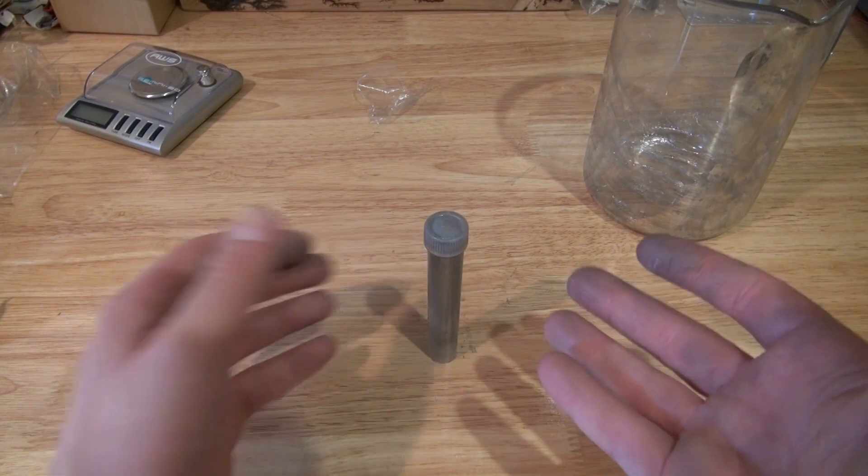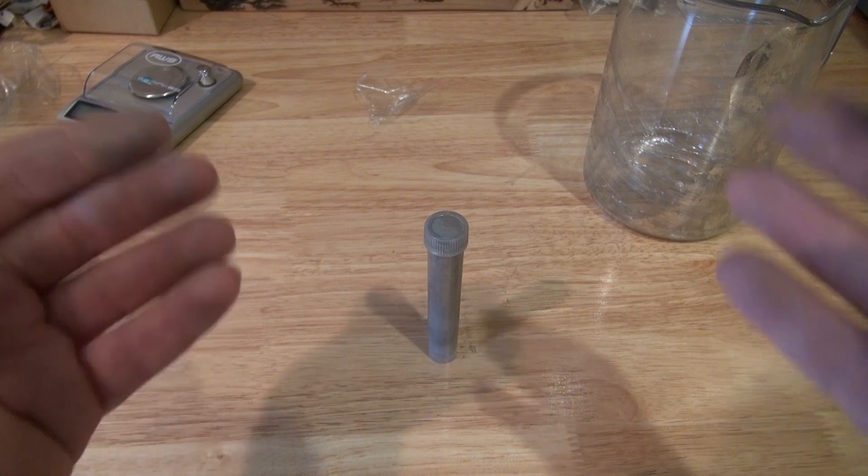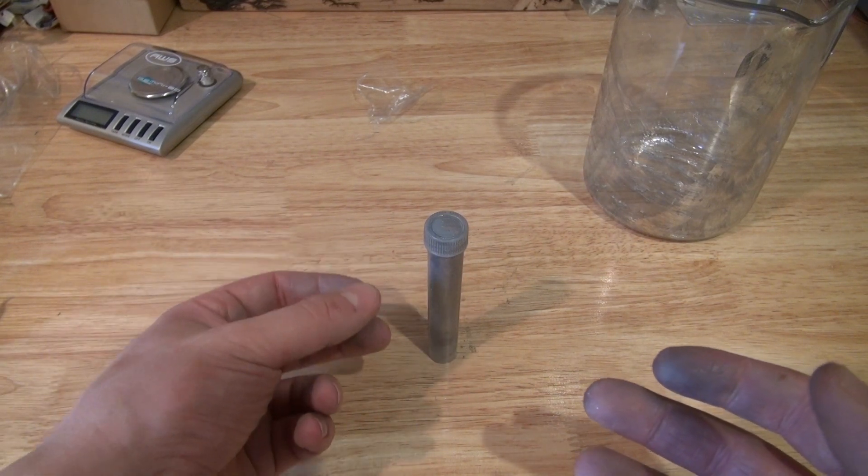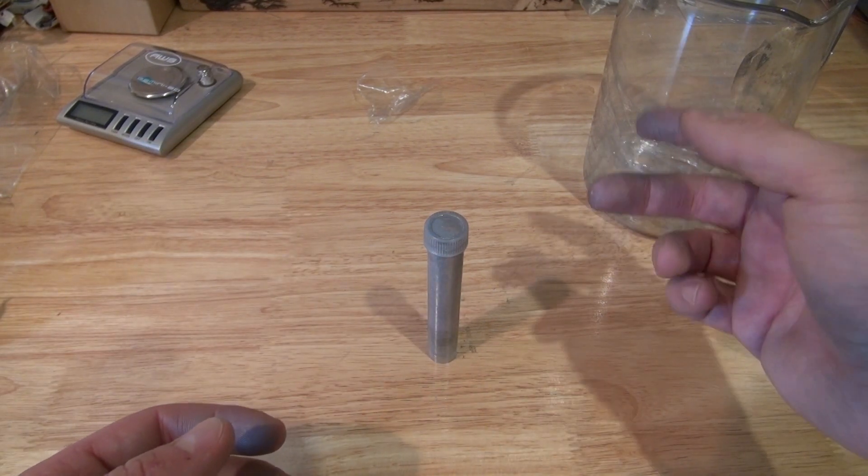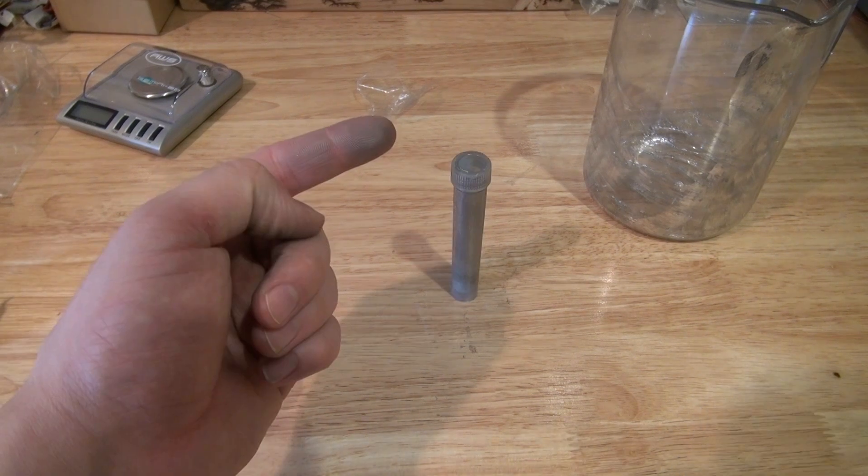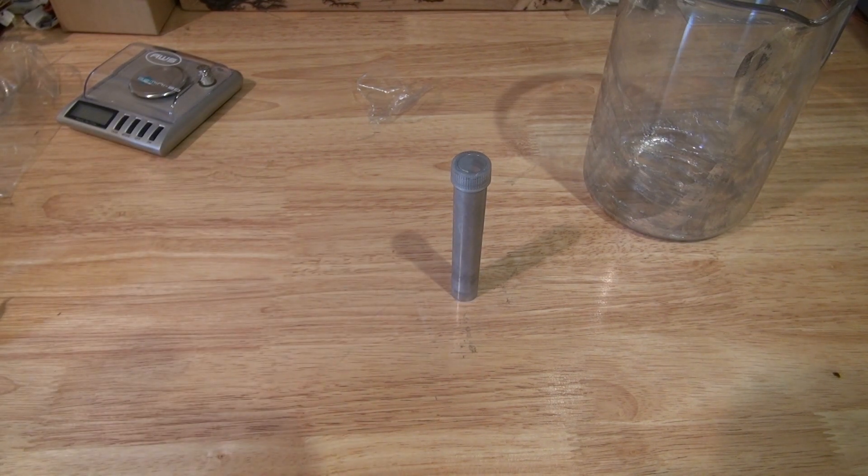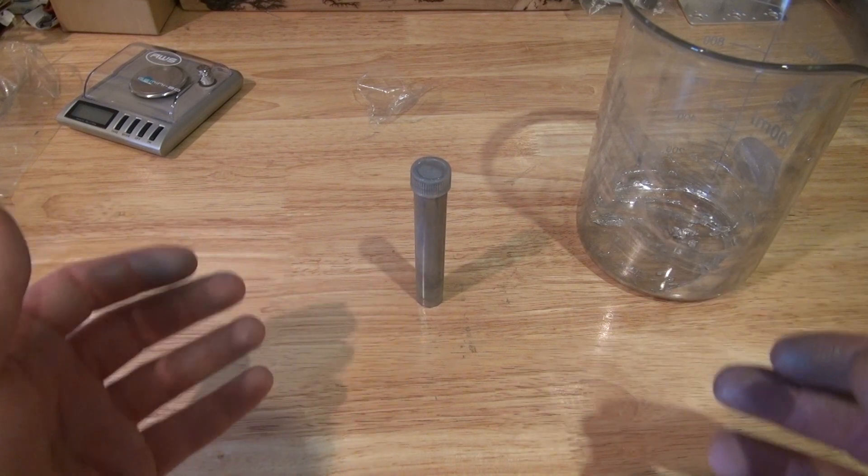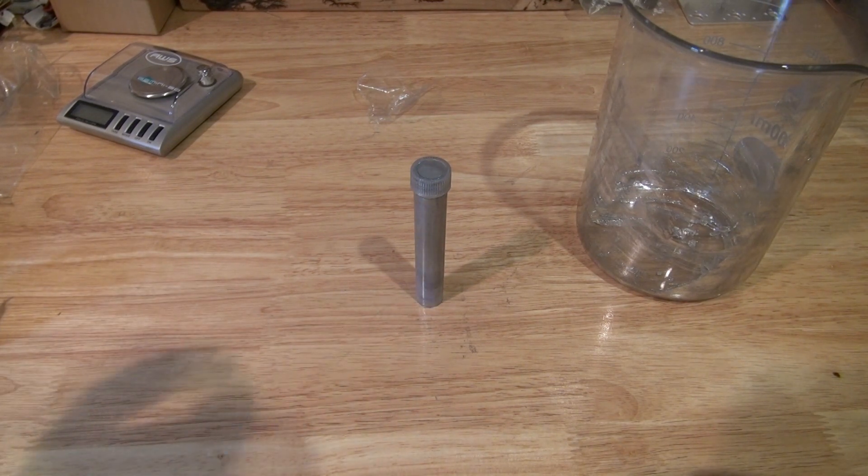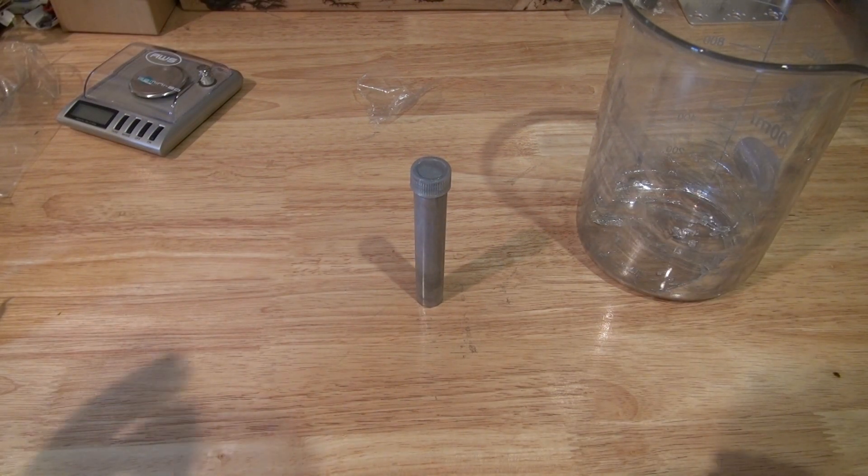Overall, I found I couldn't successfully make 50-50 percent. I was only able to make it unbalanced to create the proper alloy. I had to add more gallium to dissolve the leftover indium crystals. That gave me a ratio of no longer 50-50 percent. Now it became 35 percent indium and 65 percent gallium. That's the ratio I was able to get for a series I'm going to do with liquid metals. I'm going to do future videos to see how each liquid metal freezes, melts, and boils at different temperatures, and do all different sorts of experiments and compare density as well.